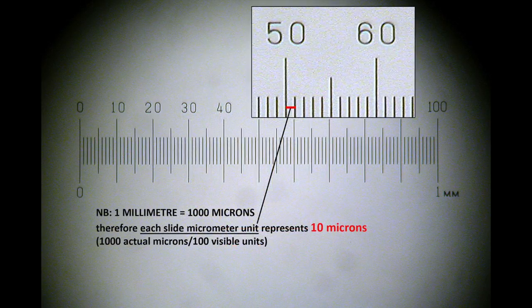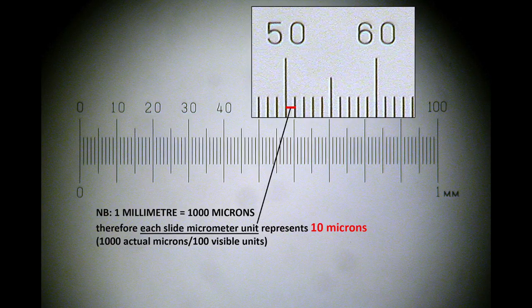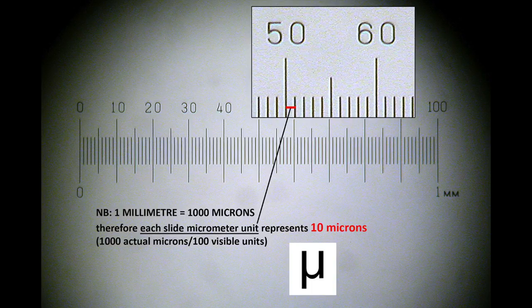As 1mm is 1000 micrometers, each subunit is therefore 10 micrometers in length. The term micrometer is correct, but it can also be referred to in short form as the micron. The Greek letter for micron is mu. So the correct written term for the micrometer is mu with a small m after it.